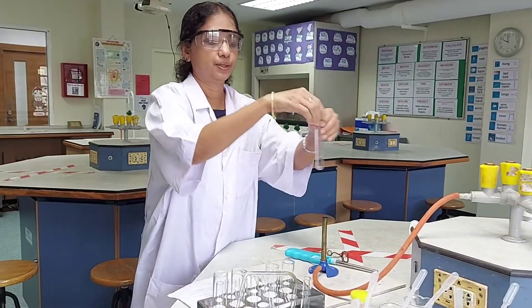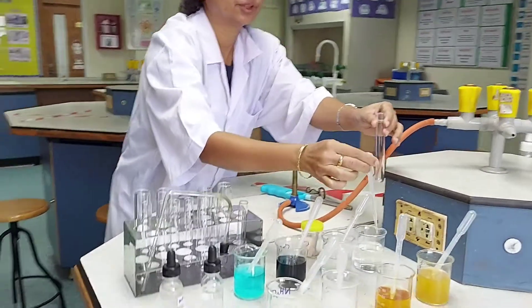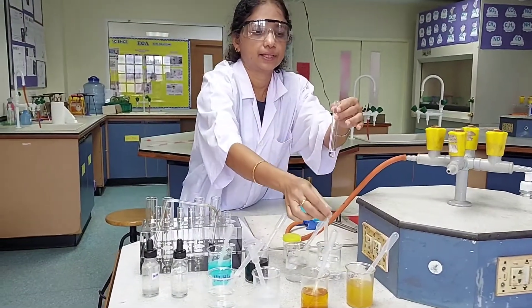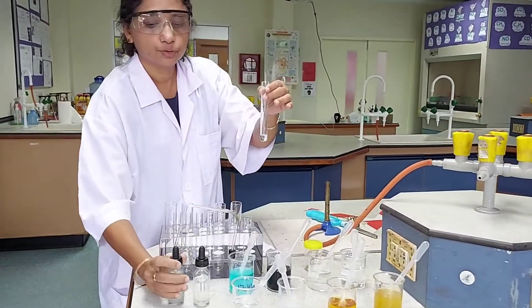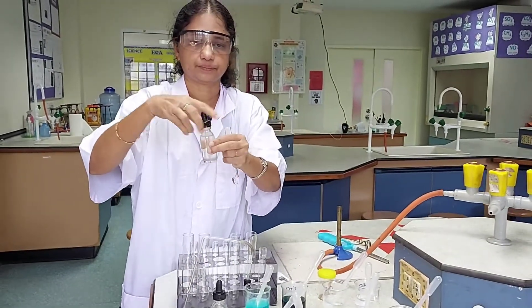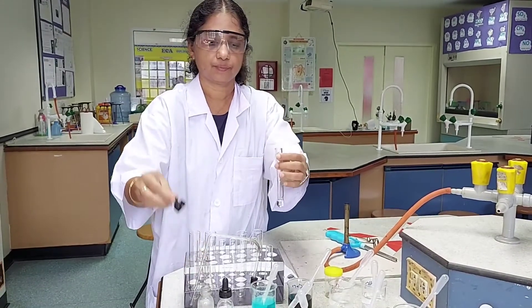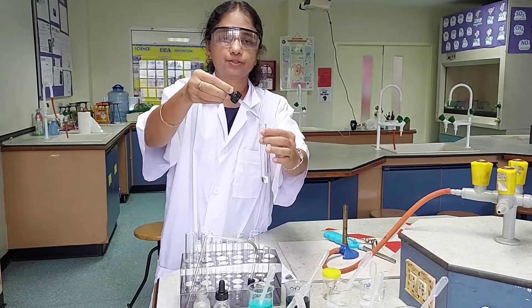In the first test tube, I will be taking the unknown solution given to me and then add a few drops of sodium hydroxide, drop by drop.